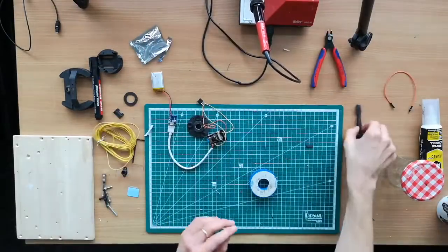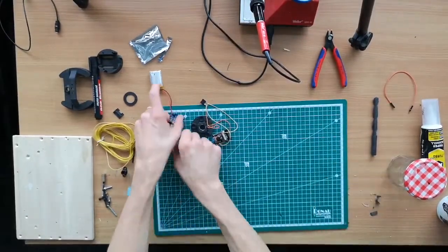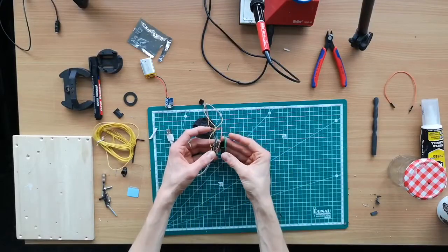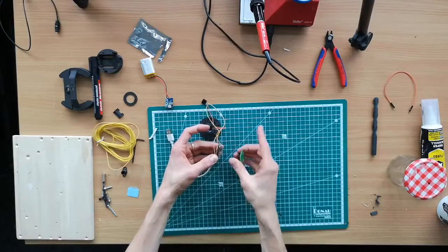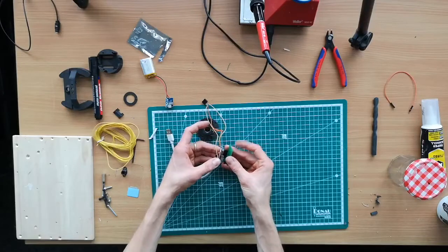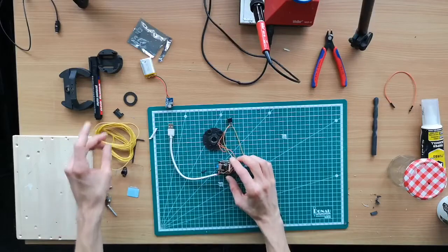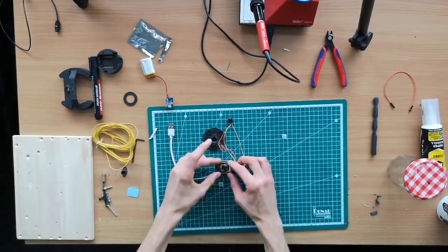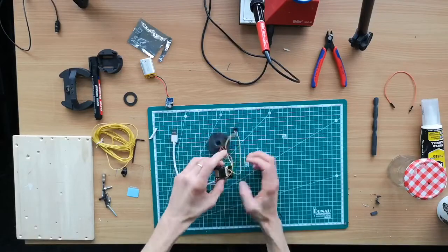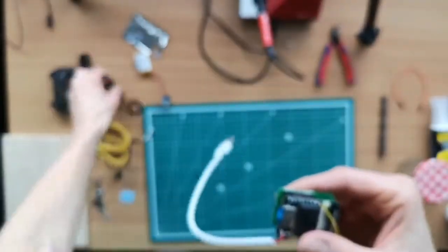And we can continue, so we get rid of these tools, clean up the workspace a bit. One thing you probably don't have is this bit here, but it's just a spacing utility, which is actually the same size as your programmer. The red one we just had usually does not come with your setup, so you just put your ESP camera in the programmer, then you add this little bit here, which mounts to the camera so that this is in the right place. This here makes sure that the camera is tightly fixed. See that here? And then this whole assembly goes in here.